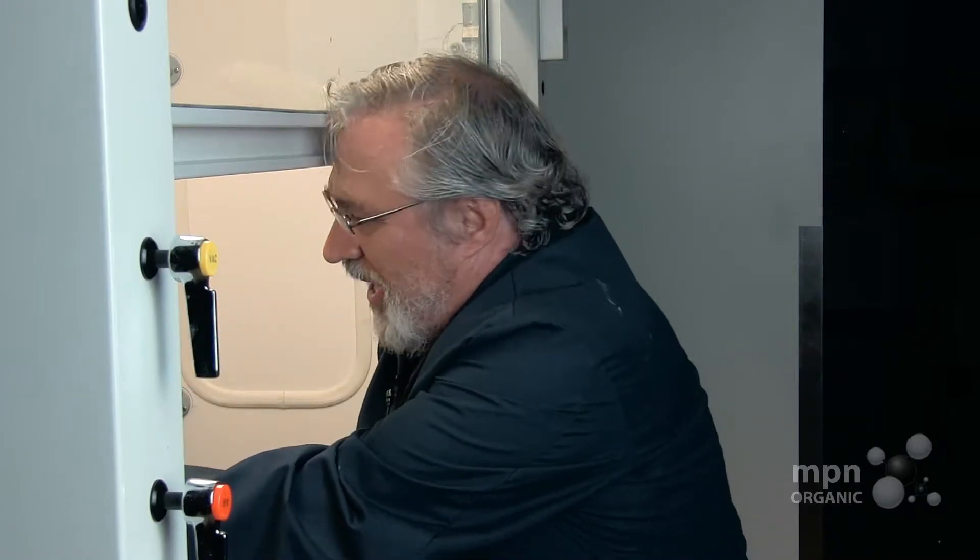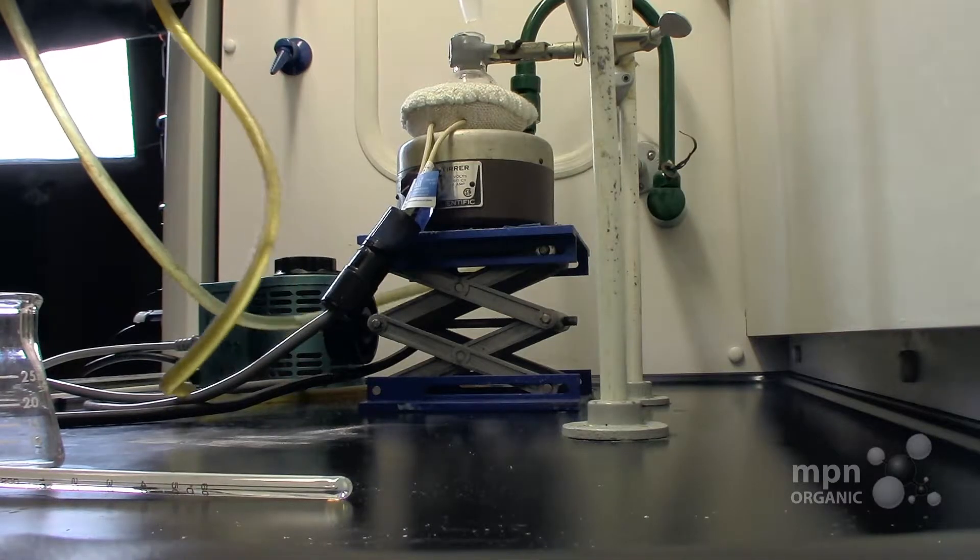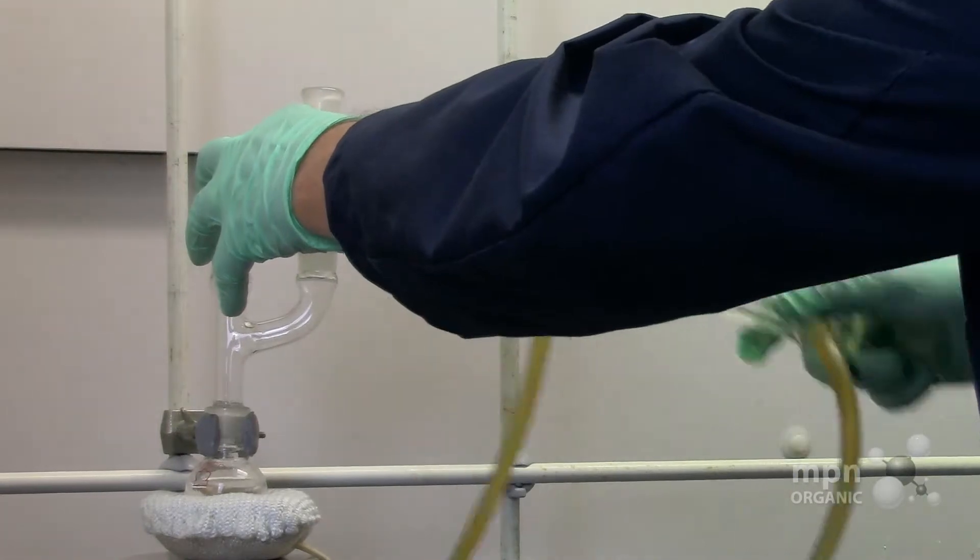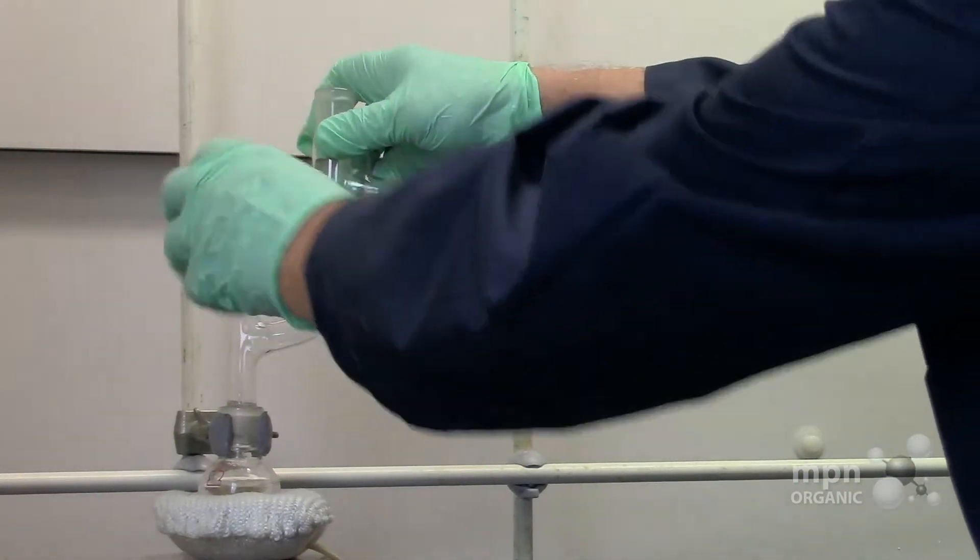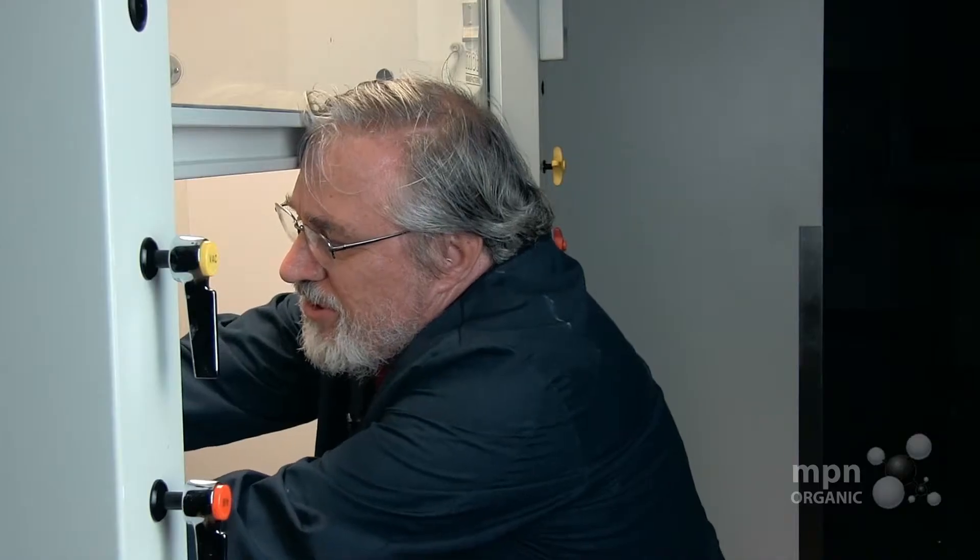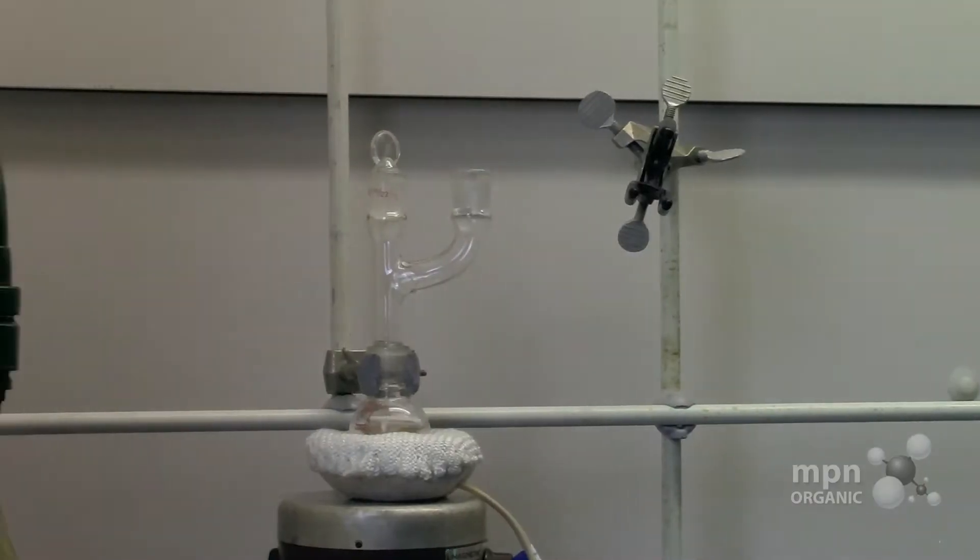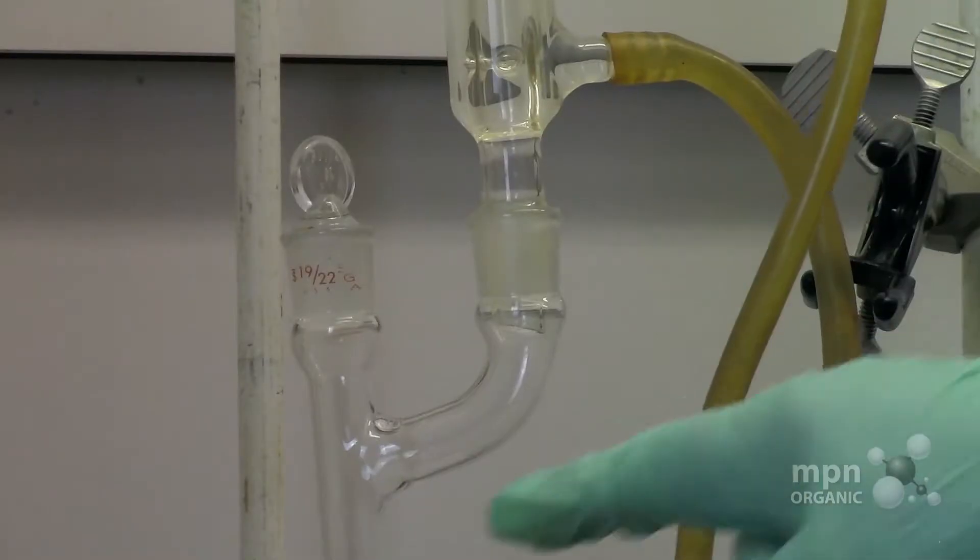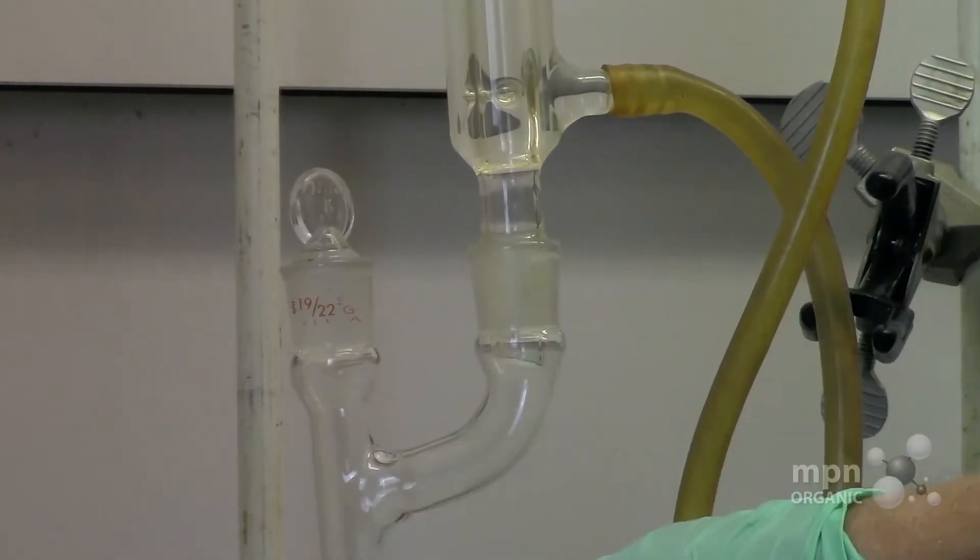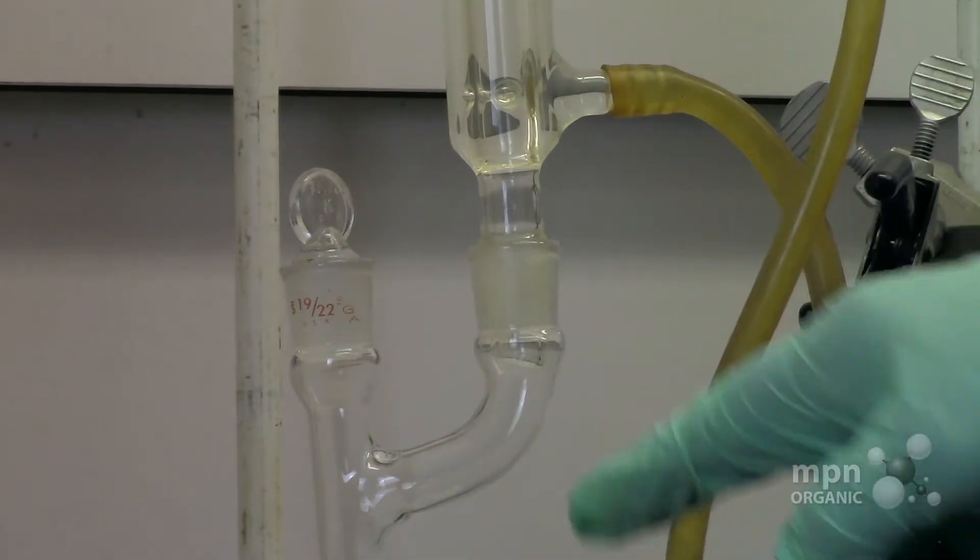So I'm just going to take this down and the rest of this like this, and I can use this then as increasing the path for the condenser.